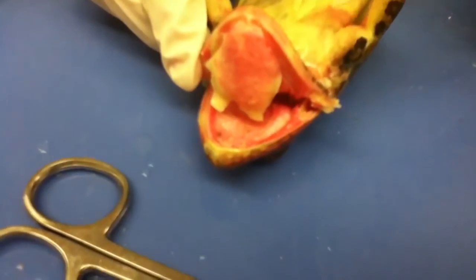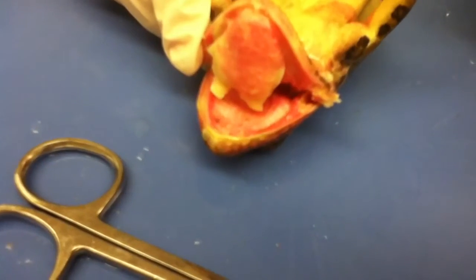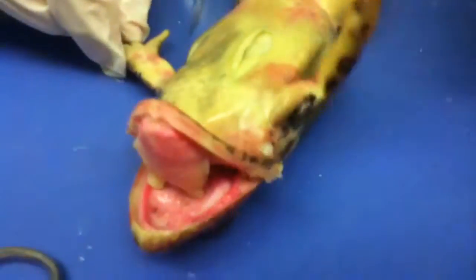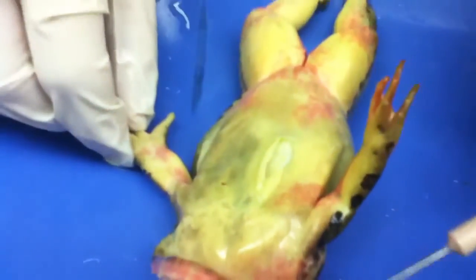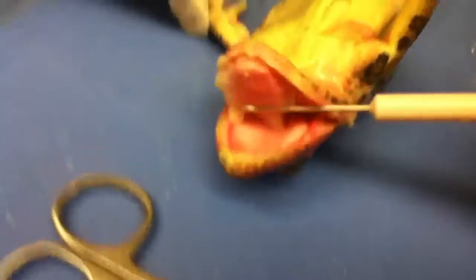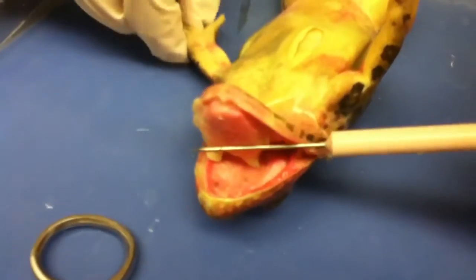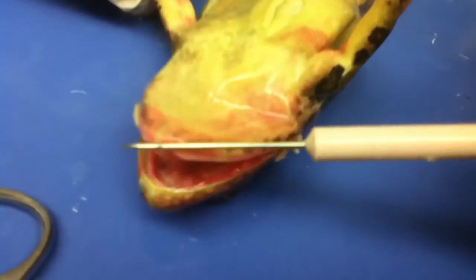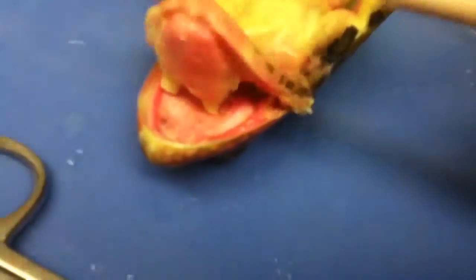I thought it was a guy. We don't know what it is yet. We're guessing it's a guy because of his pads and his hands, but we don't know. At least it would be easier to cut him open because he's ready to cut — his mouth is like open. We need to give our frog a name. Bill? No, Bill's too common, and we don't know if it's a guy or a girl yet. Jim? Okay, his mouth just stays open.